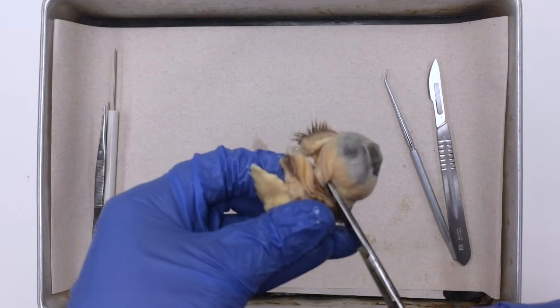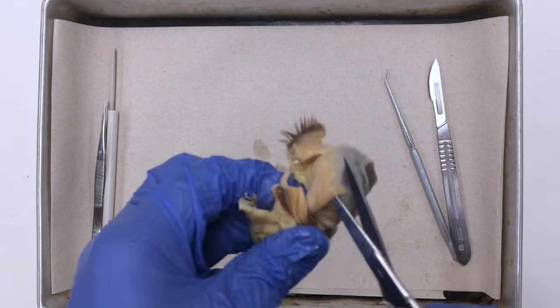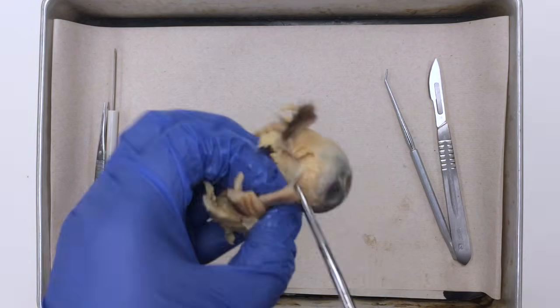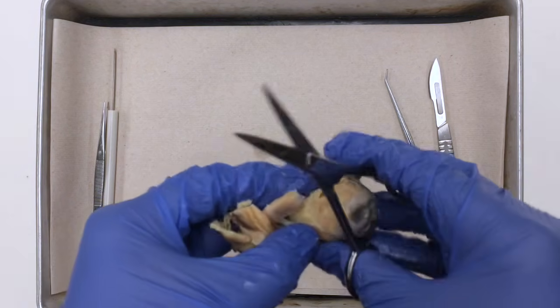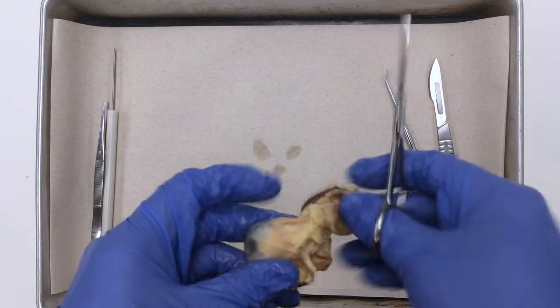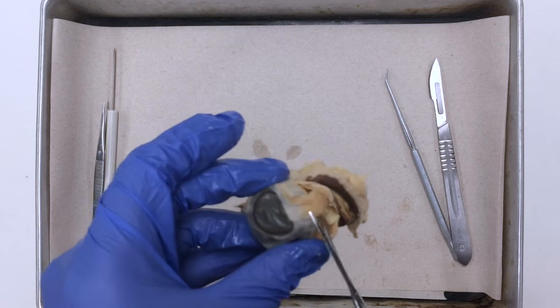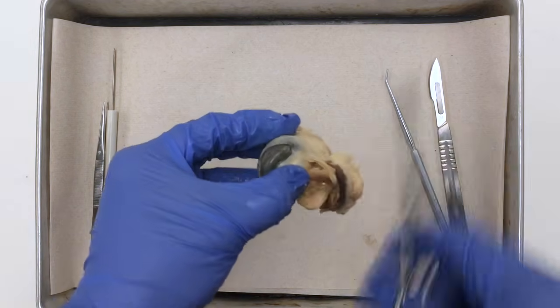We're going to use the same method. We're going to spread the structures away from the eyeball, and then we're going to trim away the fat, the eyelids and whatnot. We're going to continue this until we come to a very clean eyeball.